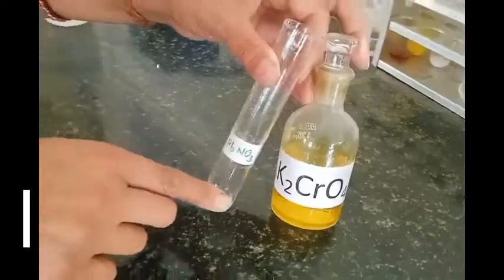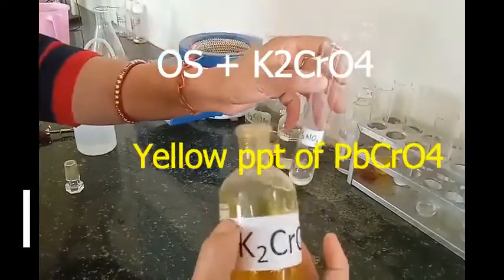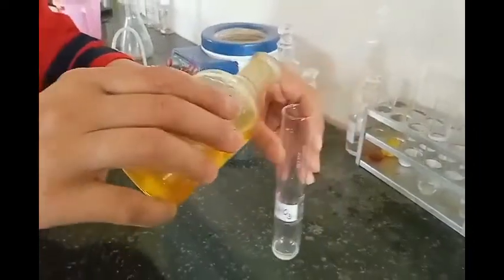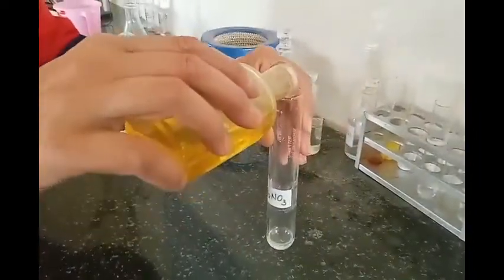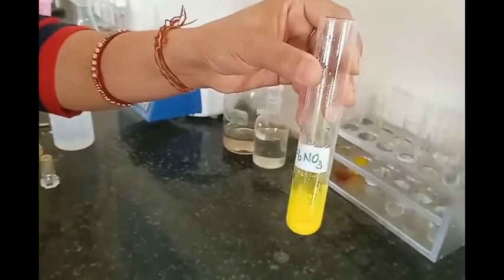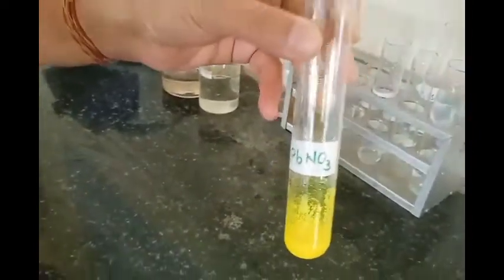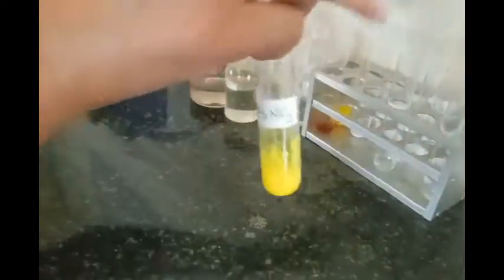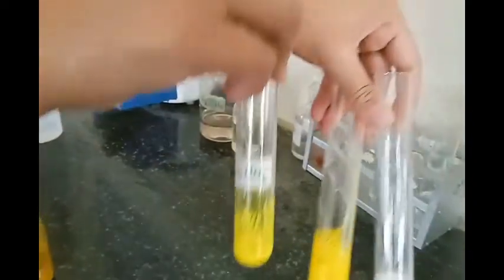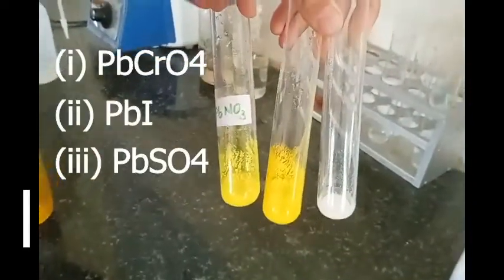In the third part, we are adding potassium chromate. Lead nitrate plus potassium chromate again gives a yellow precipitate, but these are slightly different in appearance from lead iodide. Here you can see them for comparison.